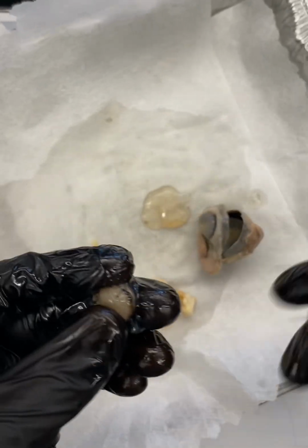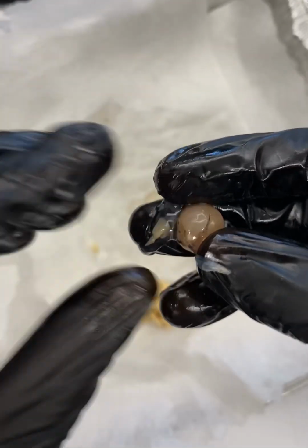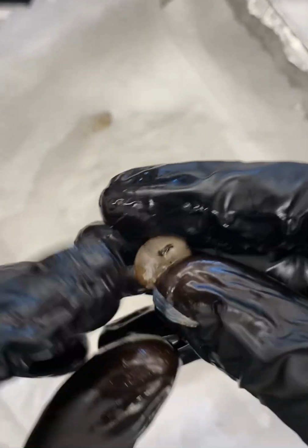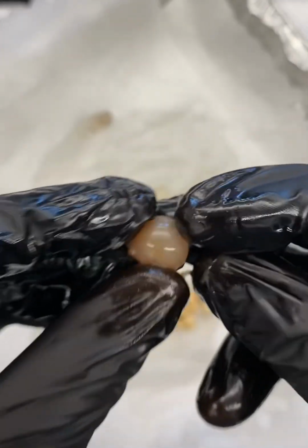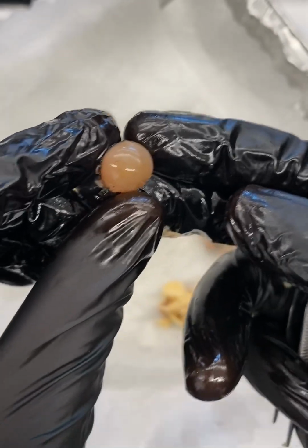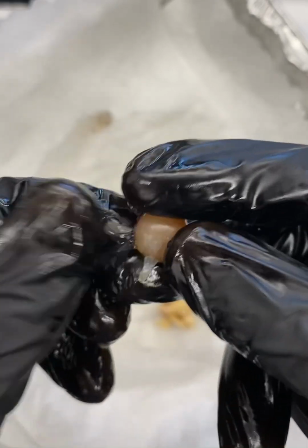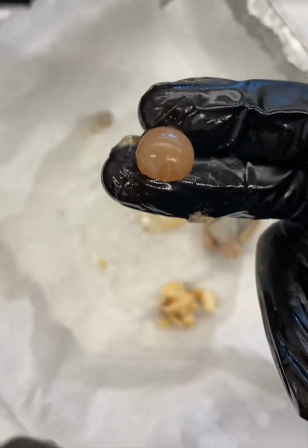We'll set the eye down for a second, and we'll look at our lens. We still have some vitreous humor adhering to the lens, and remember the vitreous humor is pushing on the lens and keeping it pushed up against the eye, keeping it in place. So this is our lens. You may have heard of lens replacement. In cadaver dissections that I've done, I've encountered cadavers who have had lens replacements.